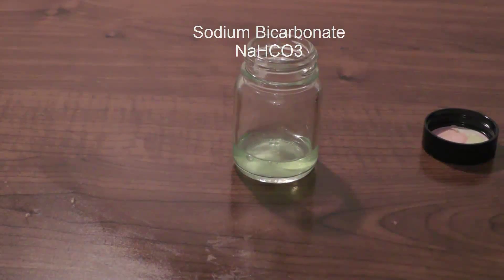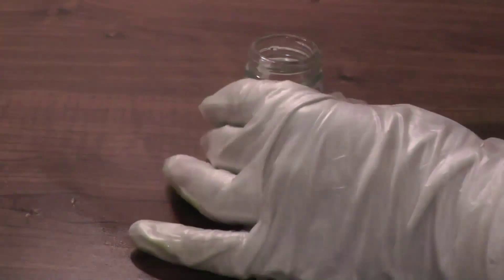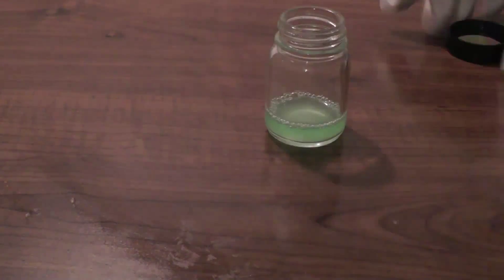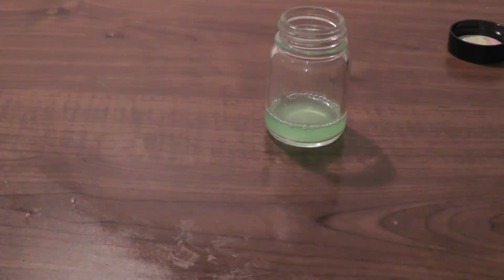This reaction works better in alkaline conditions, so add a base such as sodium bicarbonate or sodium acetate. Oops, I think I added a bit too much. I'll filter it off later.